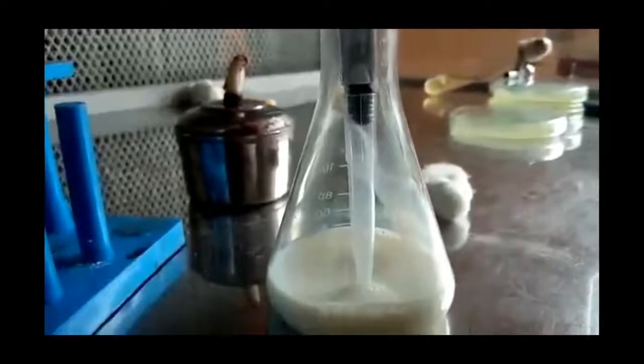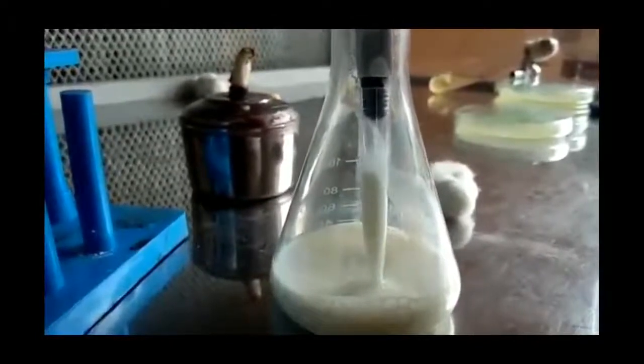Now, as we start with the procedure, we would first of all measure the amount of milk that we would be requiring for this experiment. We measure 3 ml of milk from both the solutions each. The two different samples of milk would be taken in two separate test tubes. We measure it from each of the samples and let it stay in the test tubes.